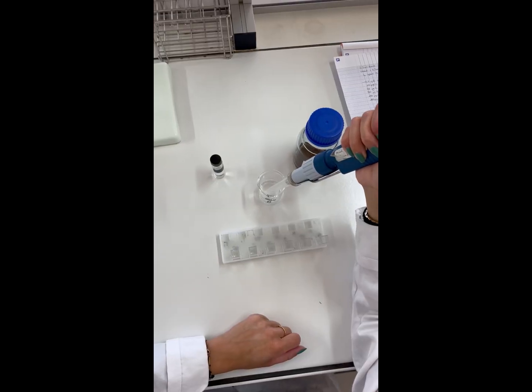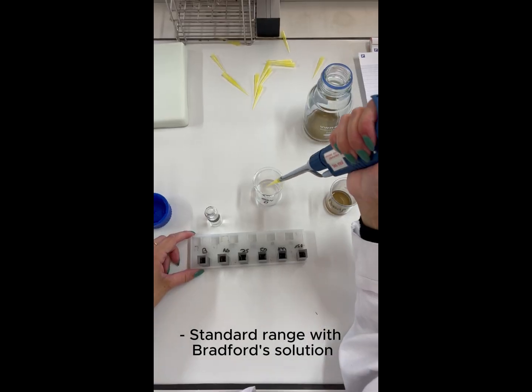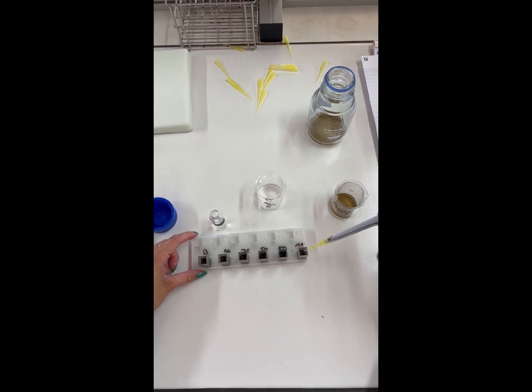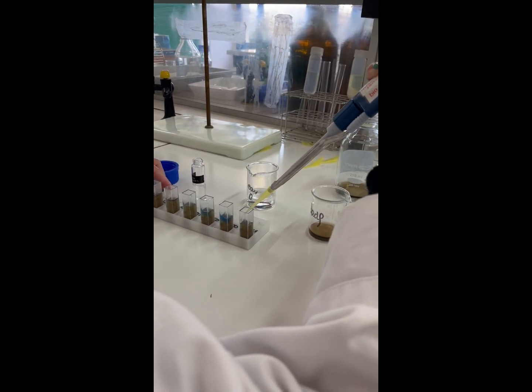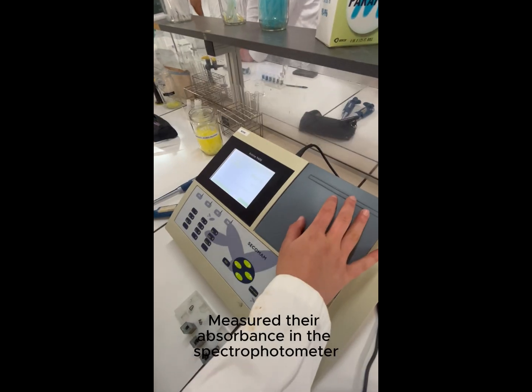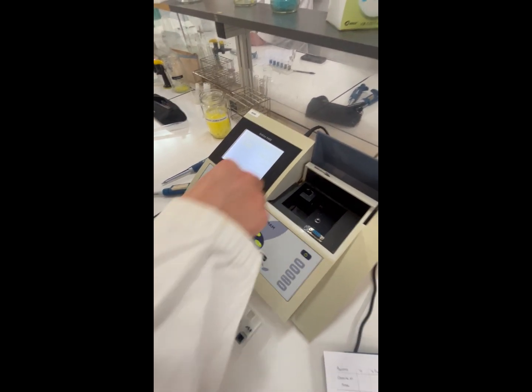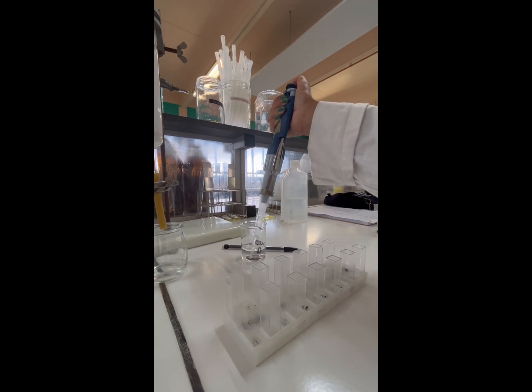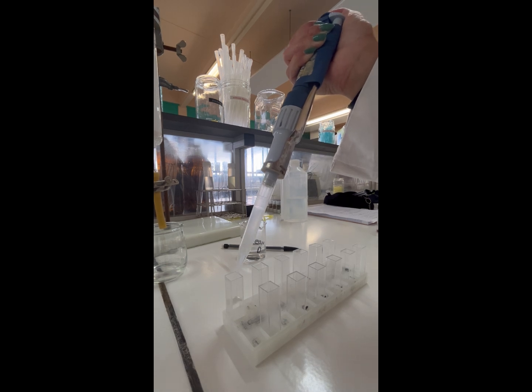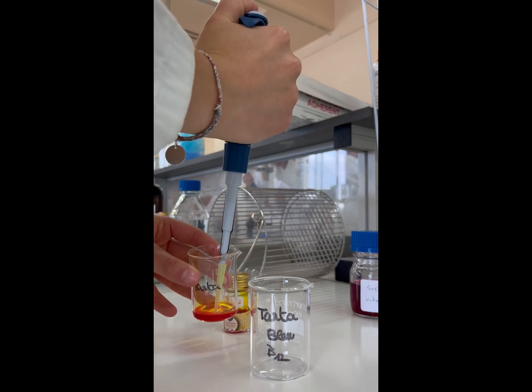We start with making a standard range in which we put Bradford solution in each tube with a different volume of BSA in each tube and top up with water. We run the solution in the spectrophotometer. Right after, we prepared 20 tubes, and since we need to put the same volume in each tube, we put 2.5 milliliters of water in each tube and draw a line.